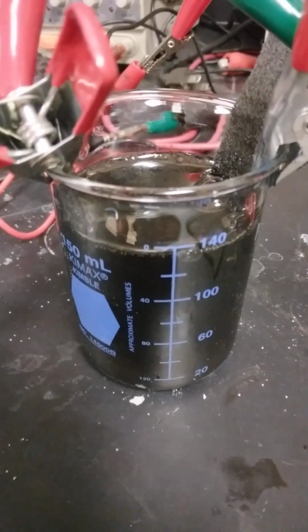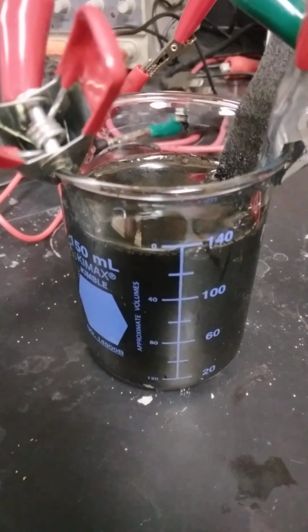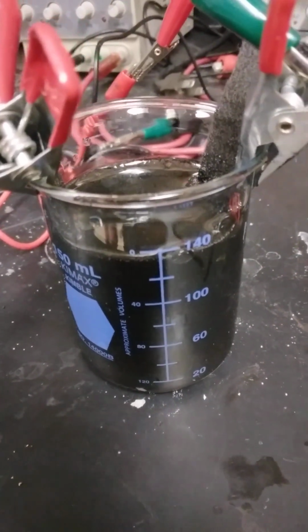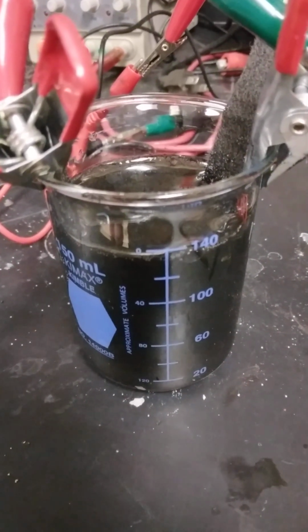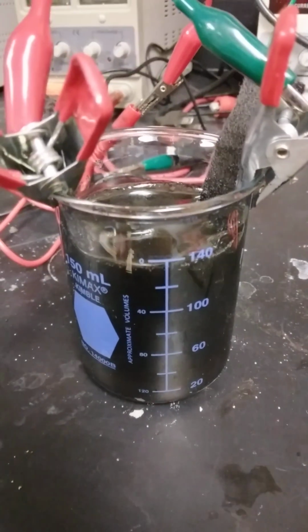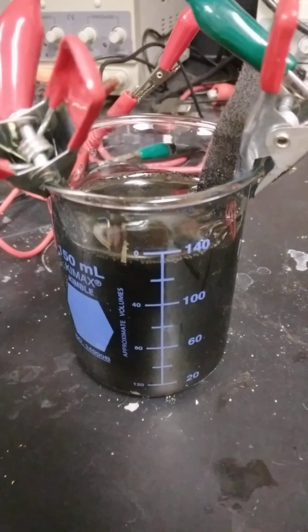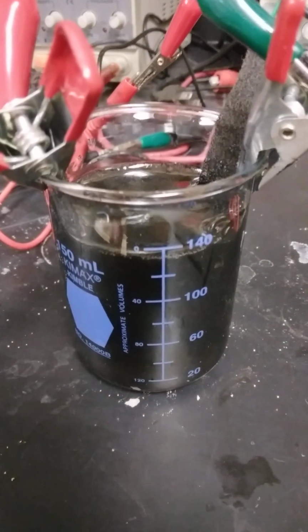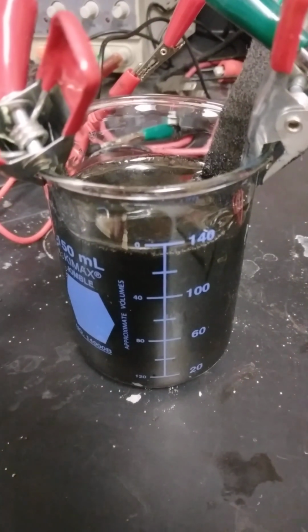And we'll keep you posted on this. I like to show things from the get-go, not finished products. It's always good to see, because we certainly in science are used to failure. But this has come along pretty good. I don't think the taco plate is the greatest way to do it, but if you are in a lab or at home, the taco plate may get you up and running.